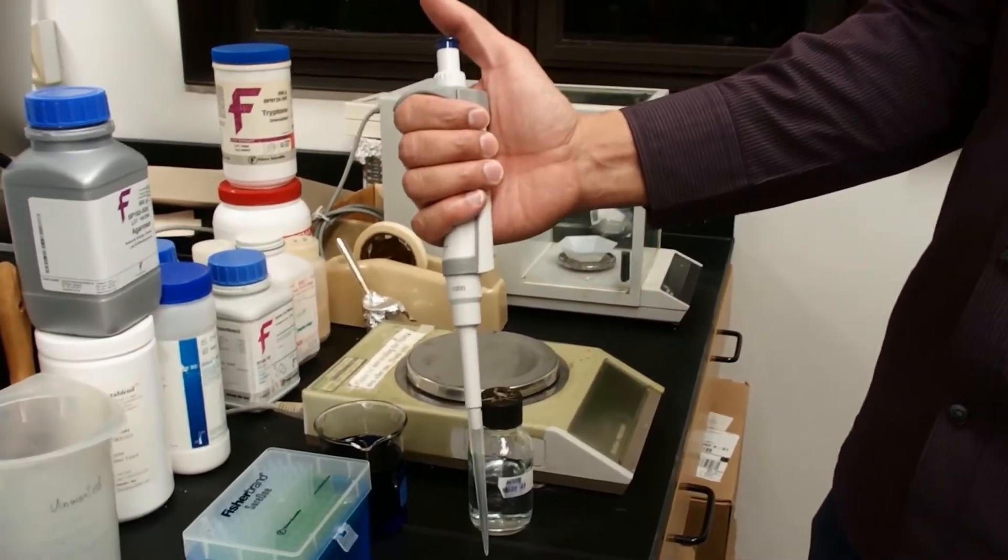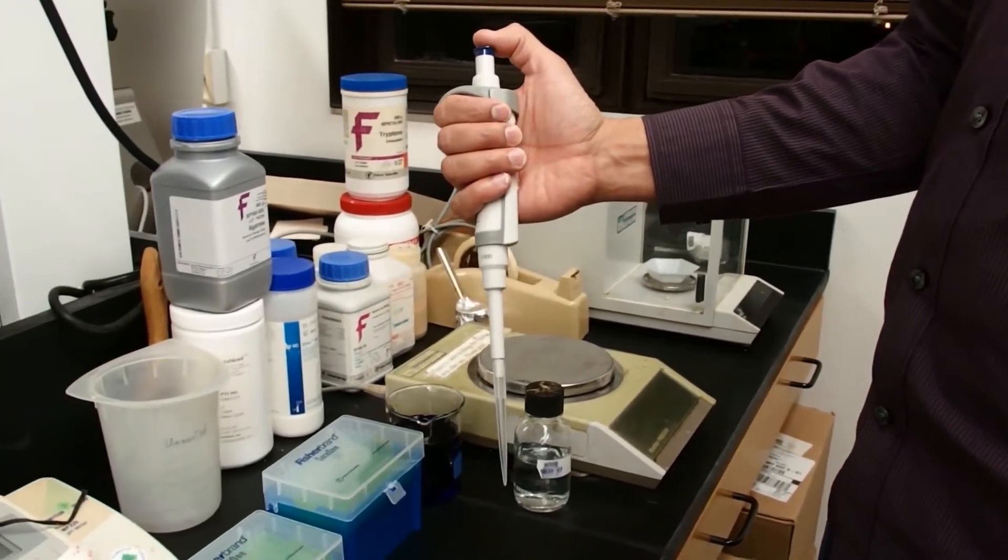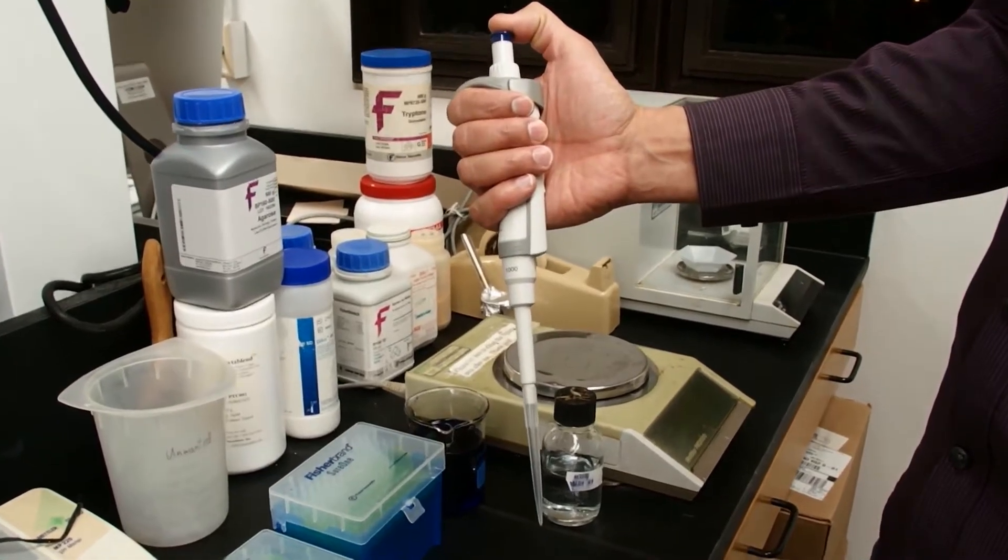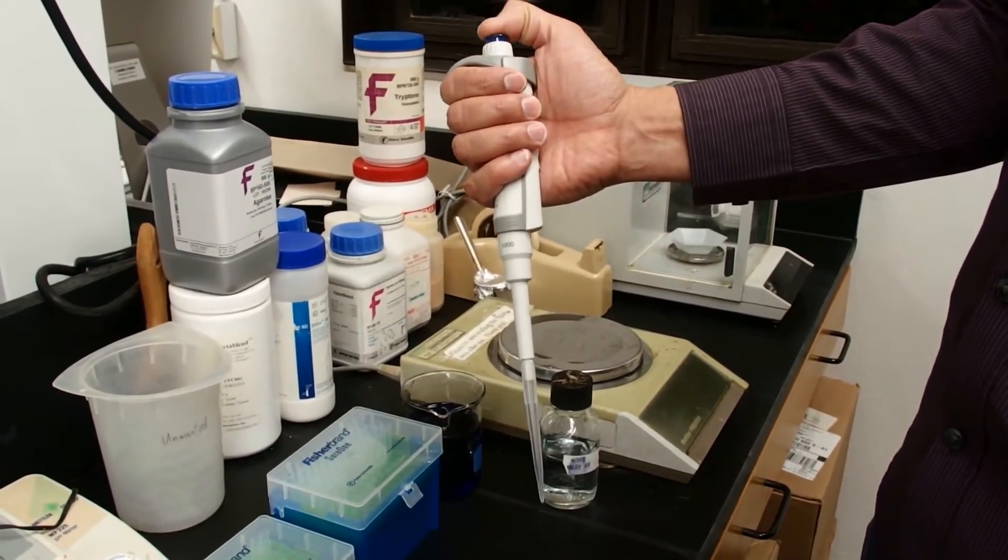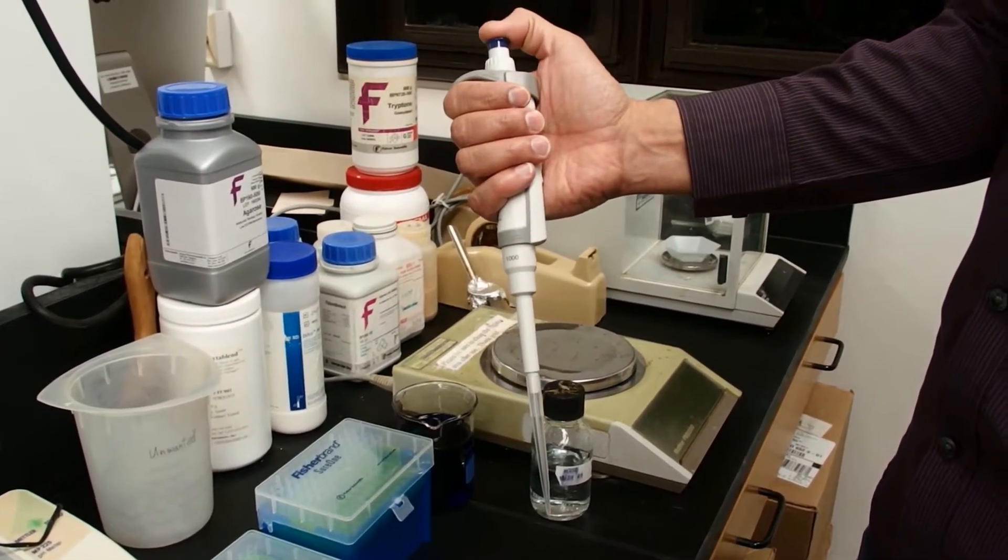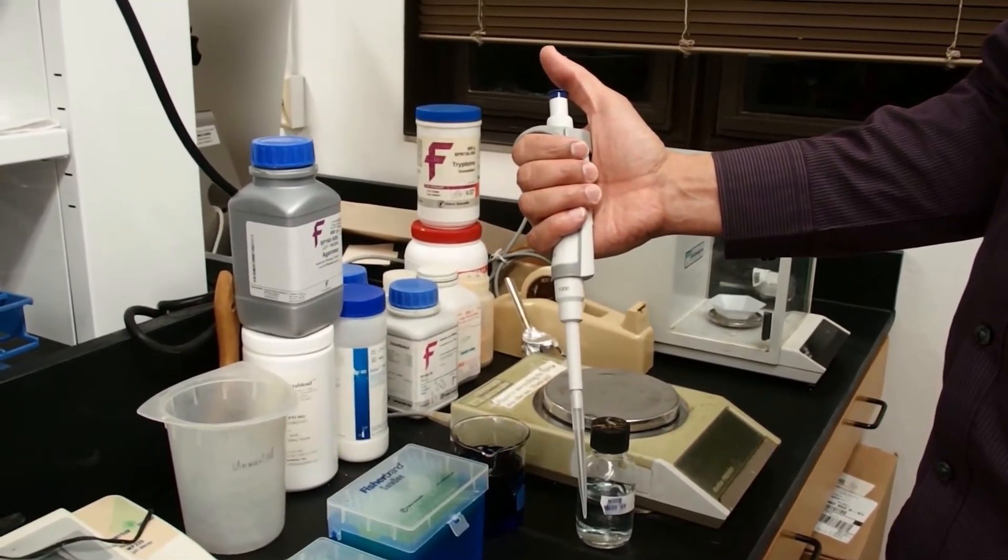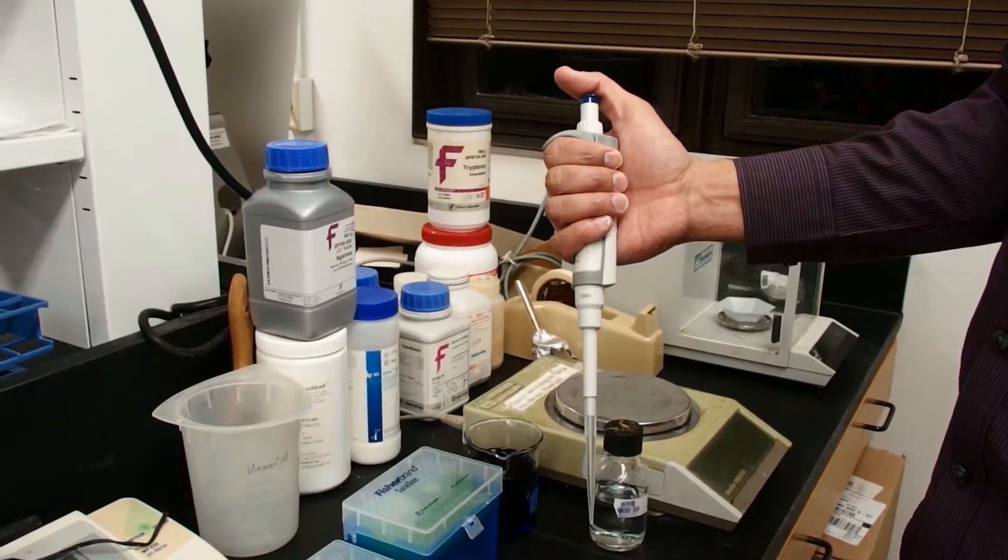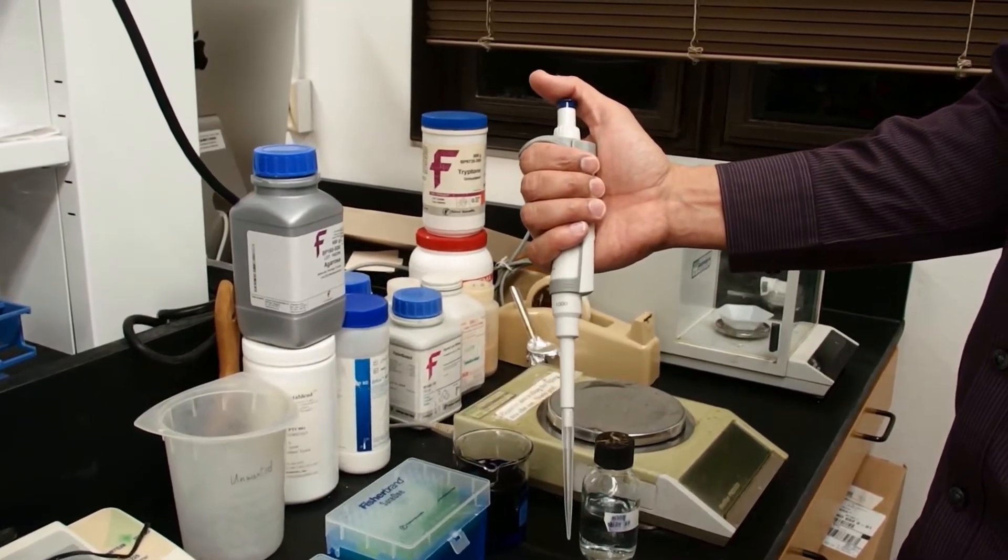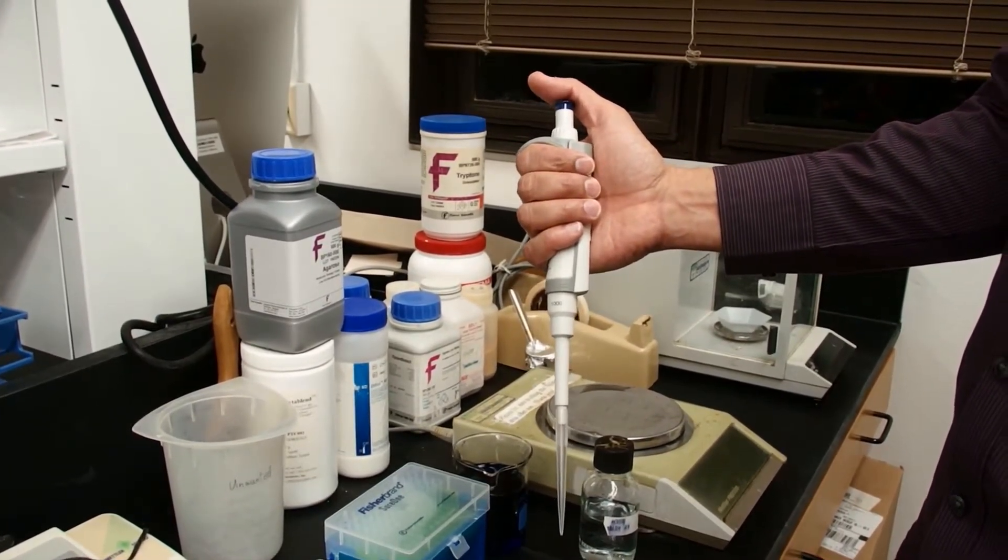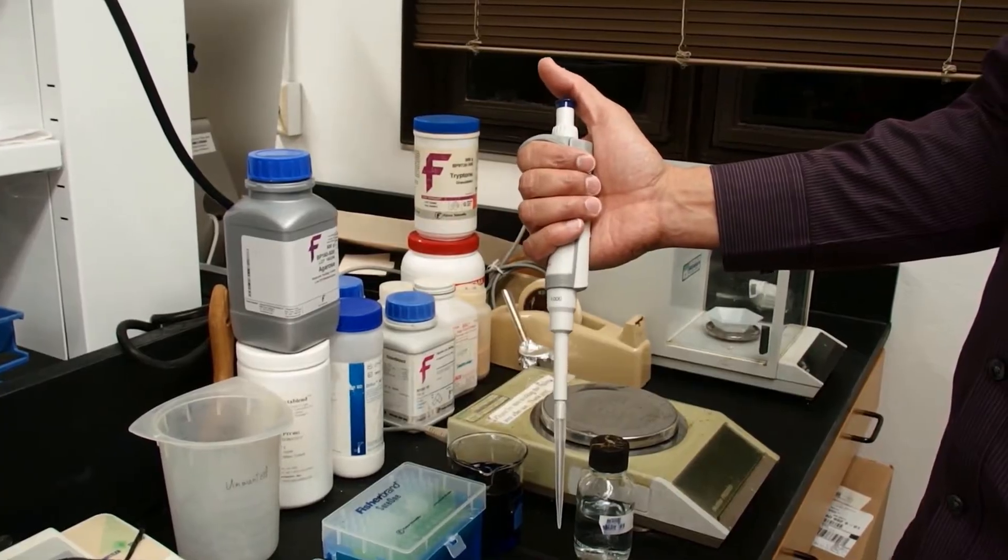There are different ways that you can press the plunger. You could press the plunger with your thumb at this position. If you're experienced, it may be fine. For beginners and people who want more control, if you move your thumb forward, you will have more control and more power here.